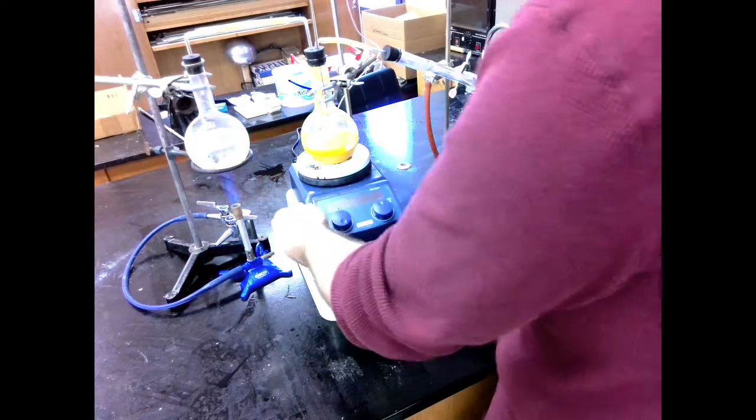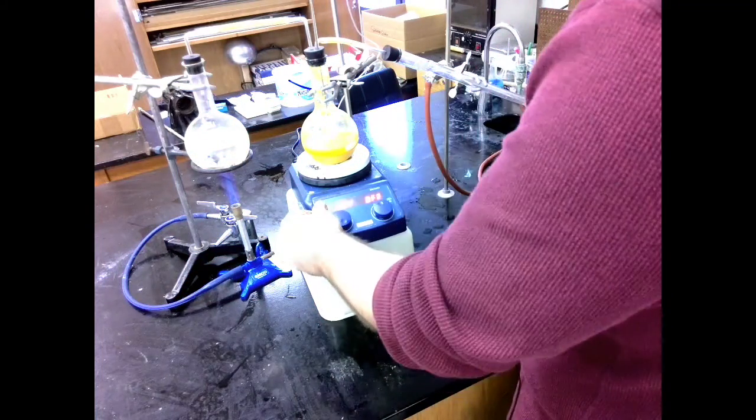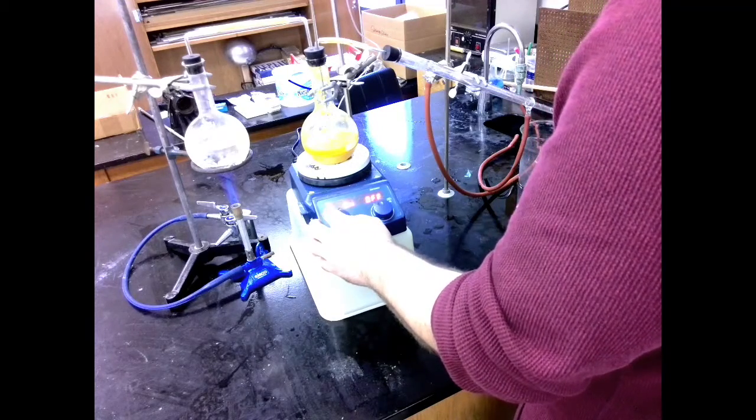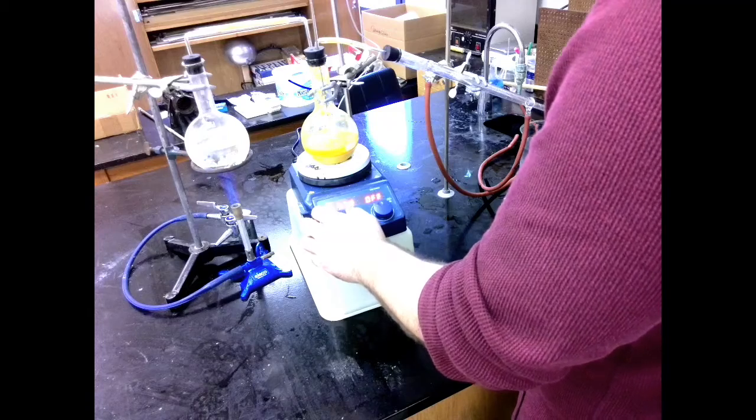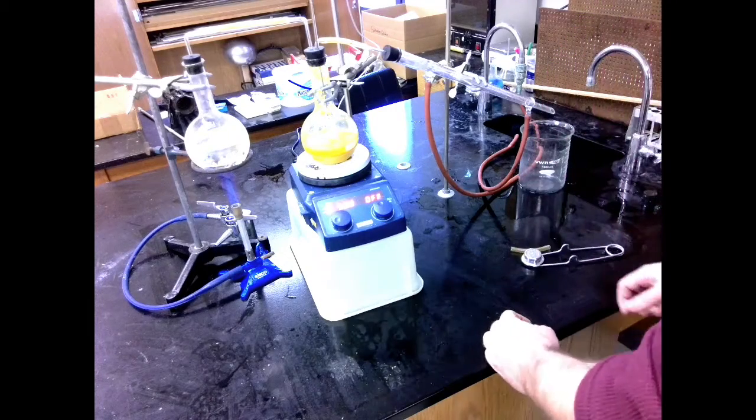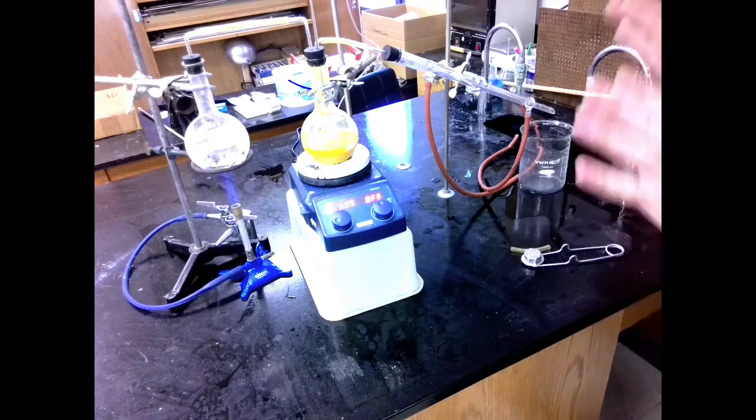Alright, now we've got that. Next, I'm going to turn on my hot plate. I'm going to turn on my heating and I'm going to set my temperature to 90 degrees.